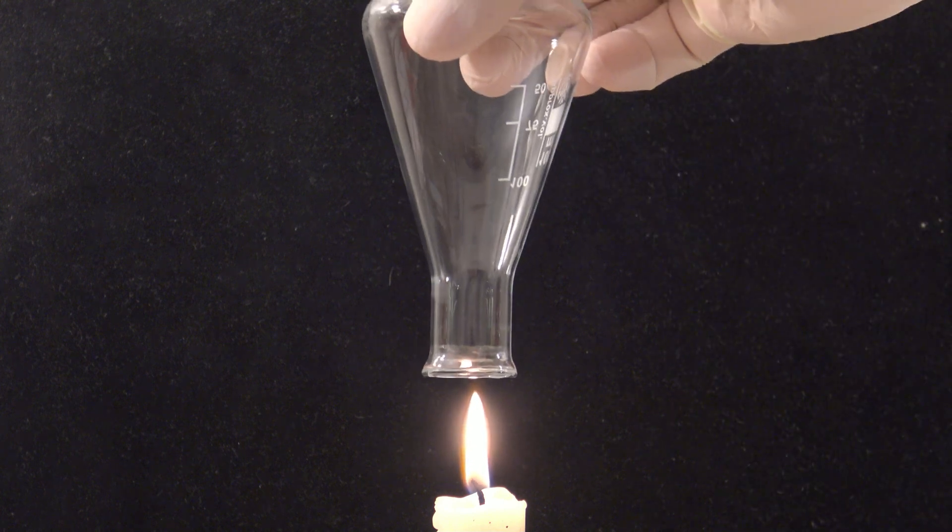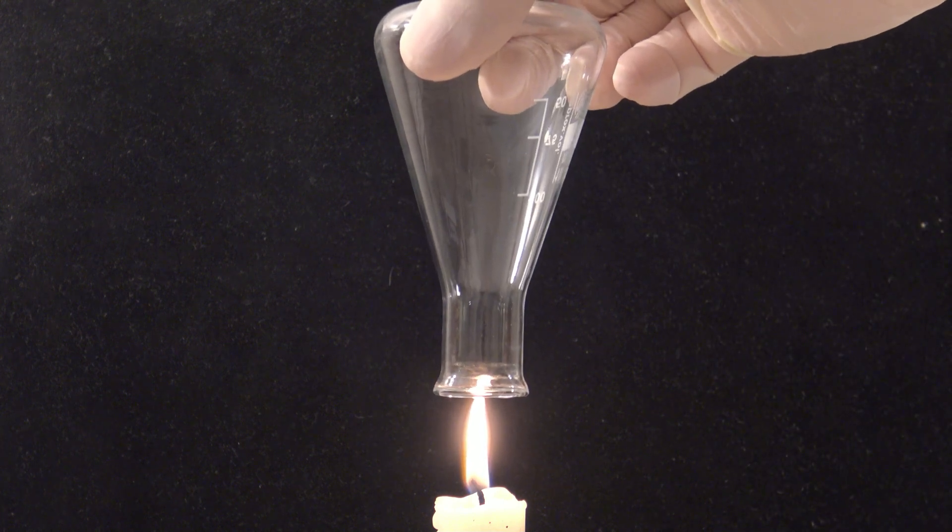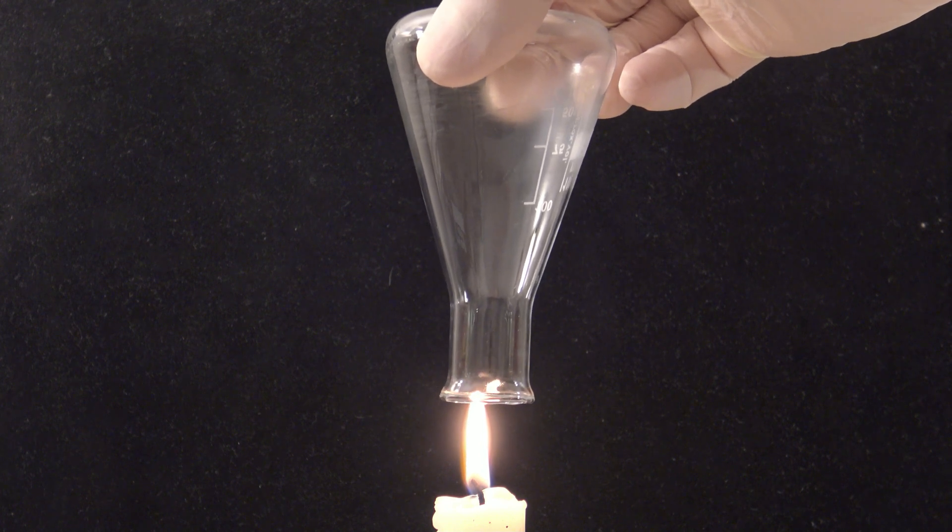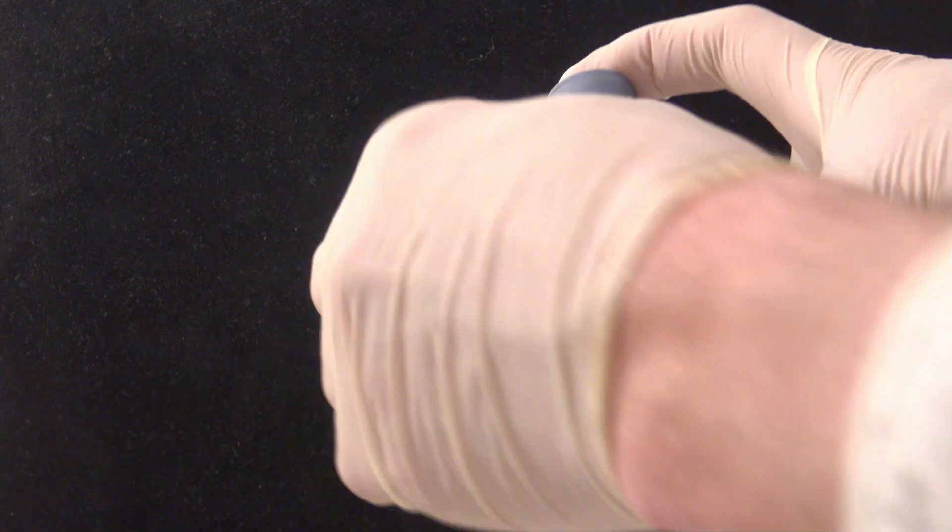In another experiment, another flask was held above the flame. It would have been sufficient to hold the flask above the flame for a few seconds, but this way the water could be shown again. Of course, both of these experiments can be made with the same flask.